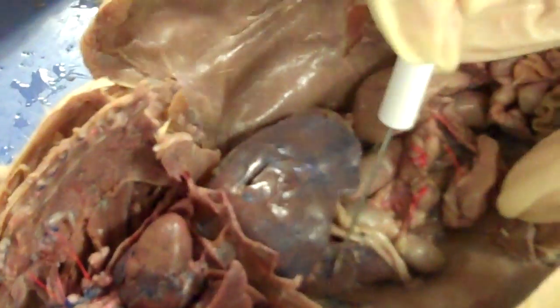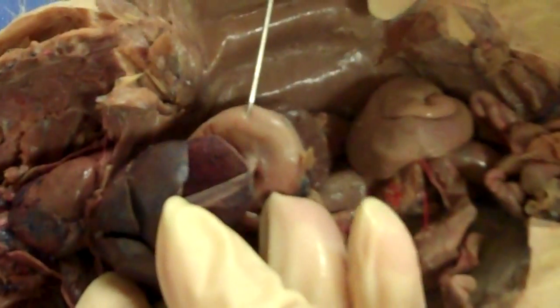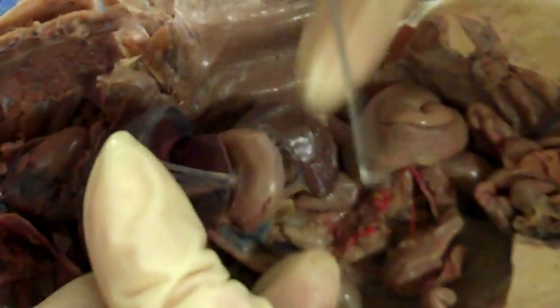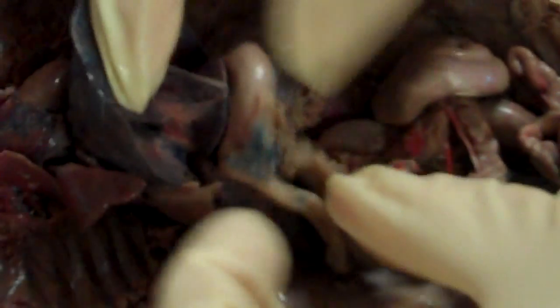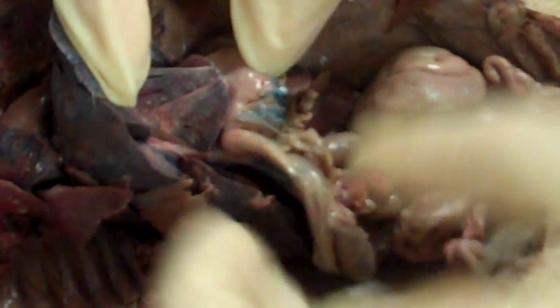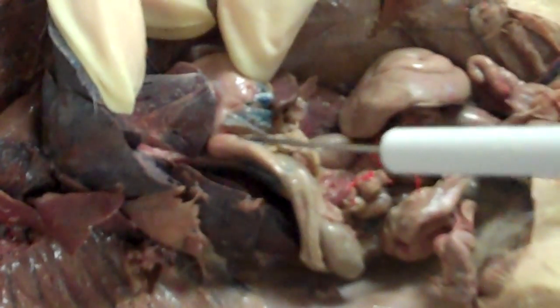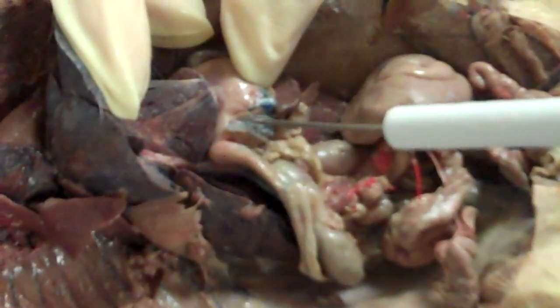This is your liver. Lift up the left side of the liver and you find the stomach, leading into the small intestine right here.